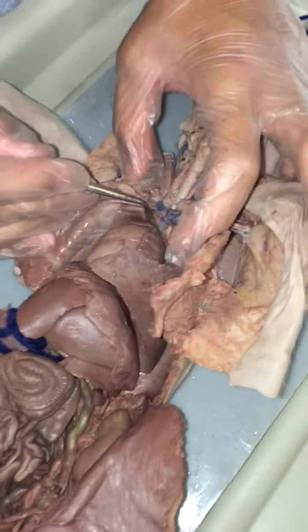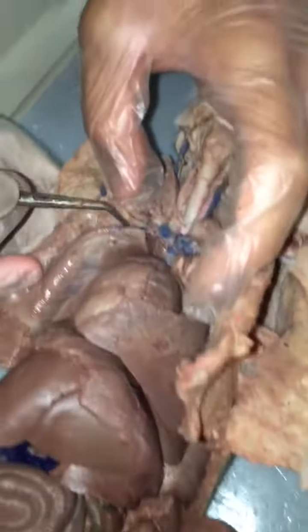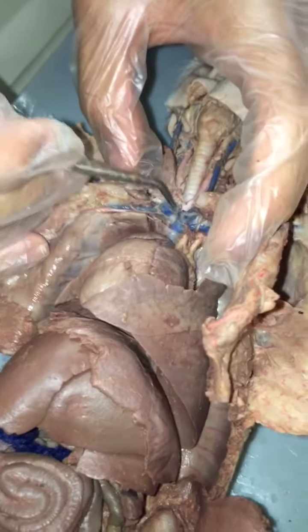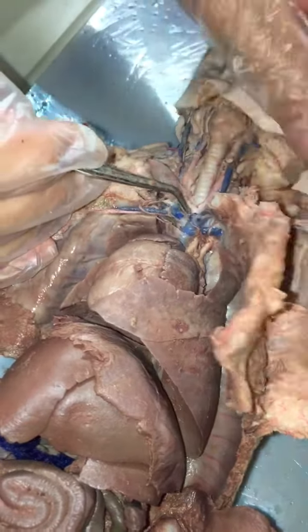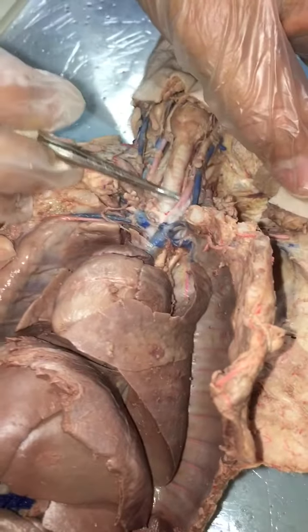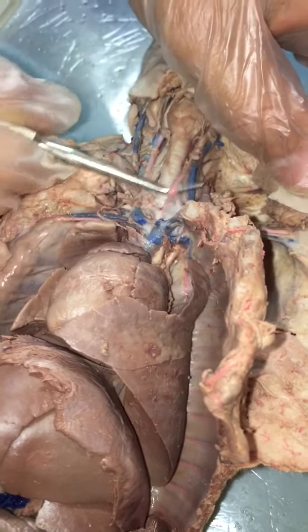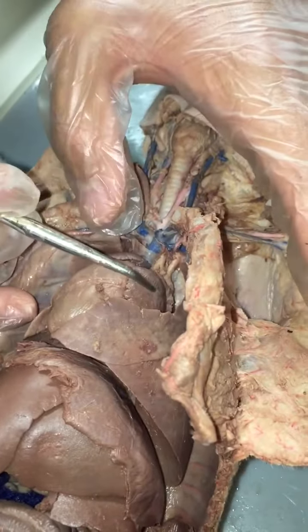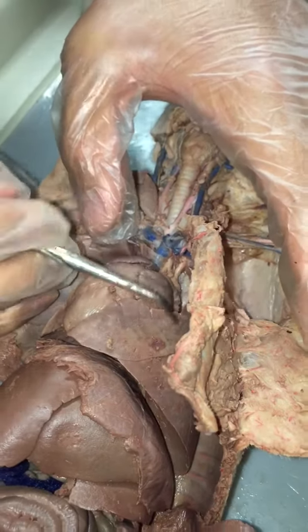The brachiocephalic right now. Okay. And then it continues. If you go back to where brachiocephalic was and go straight instead of turning, it becomes a common carotid trunk, and then the carotid arteries, which are up here. So that's the left carotid and the right carotid artery. Yeah, we'll go over it again. Okay, branch from the carotid trunk.